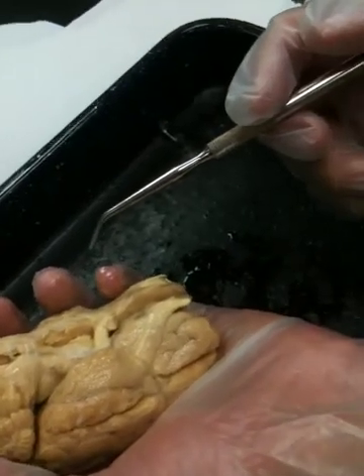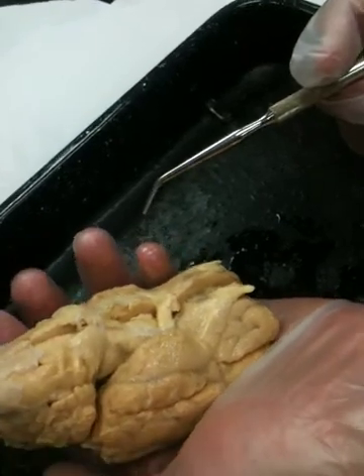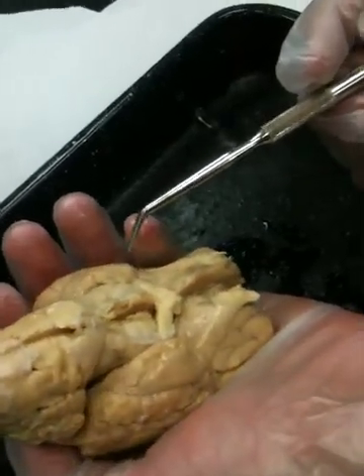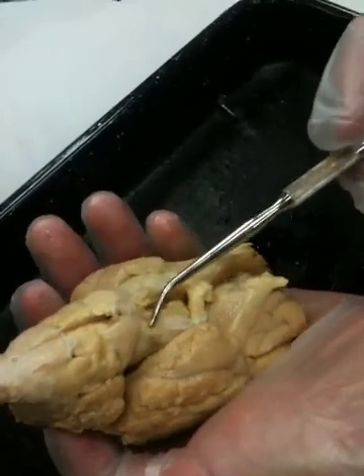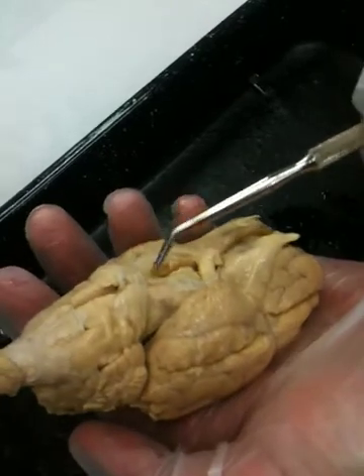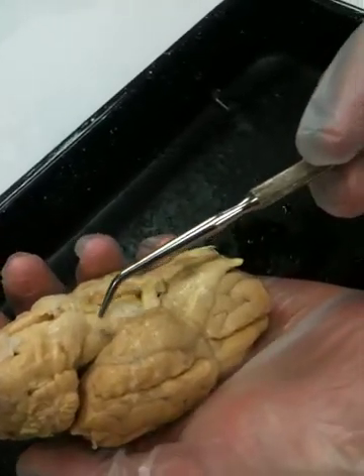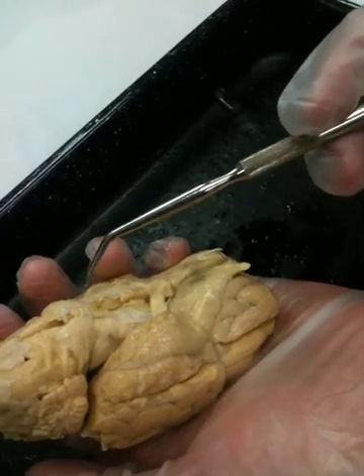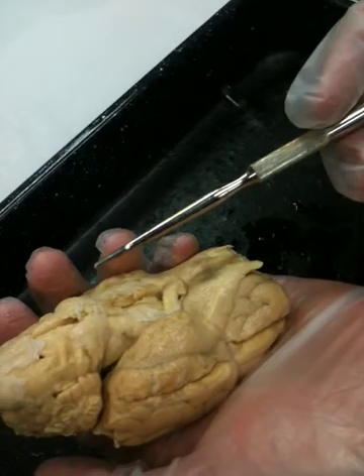Now, anchoring that membrane in place are these cranial nerves. You guys see these cranial nerves? They're two small cranial nerves. This happens to be cranial nerve pair number 6. There are also other cranial nerves that you can see underneath, anchored to this membrane. So wherever we have actually dissected several pairs of nerves that are anchored to the membrane, you have to locate those first. Be very careful to take that membrane off. It's possible they can rip the cranial nerve right off, so twist them away from the membrane before you remove this, so that you don't remove the nerves at the same time. They're small and they're fragile. Just keep that in mind.